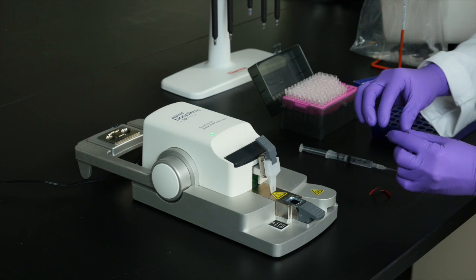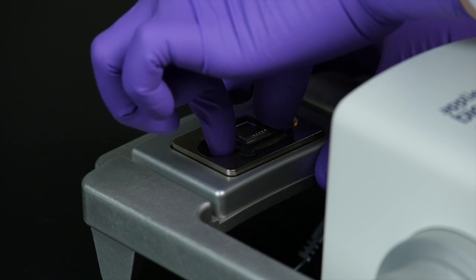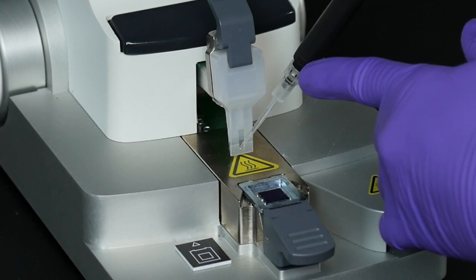Next, place the chip lid in the holder located on the swing arm of the instrument. The reaction mixture is then loaded into the loading blade.